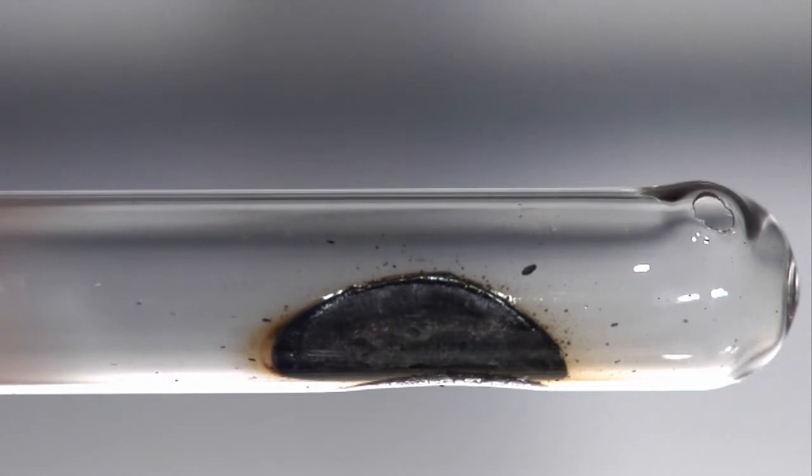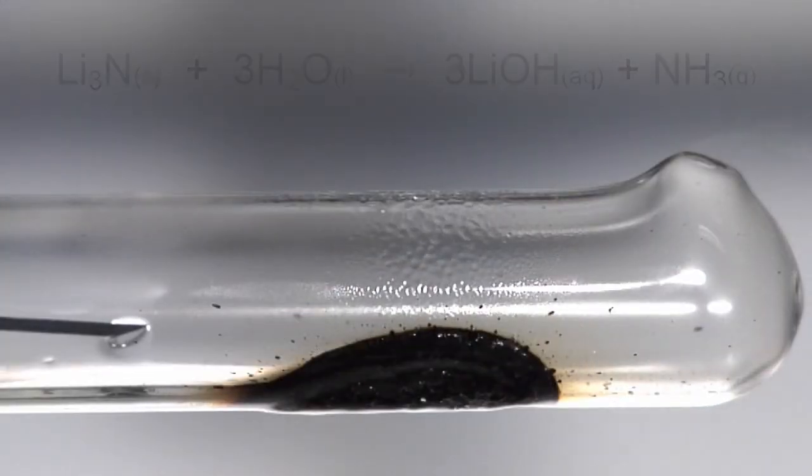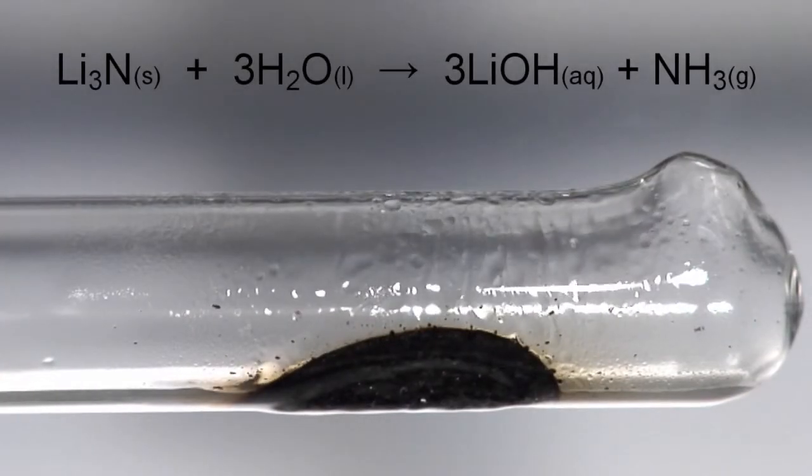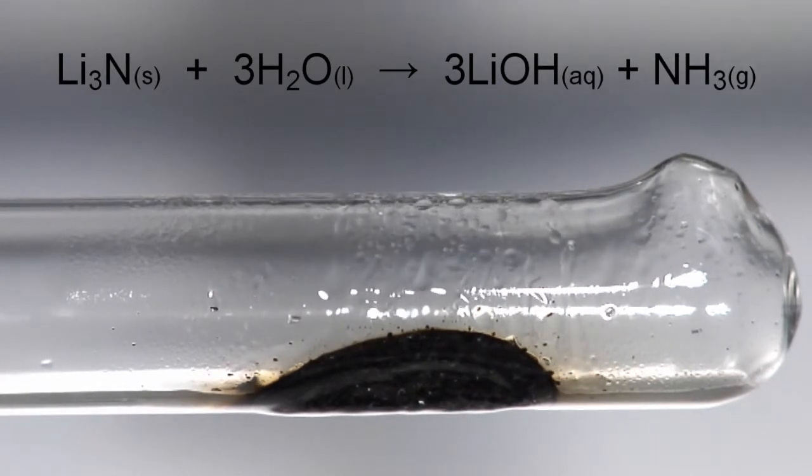Addition of water to the lithium nitride product causes hydrolysis, forming lithium hydroxide and ammonia gas.